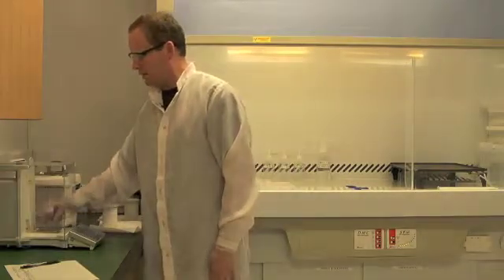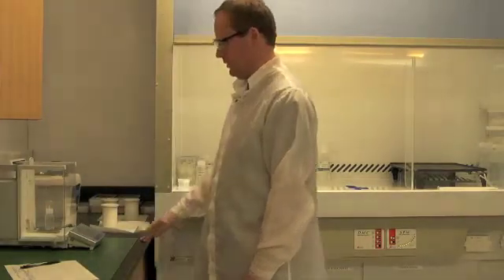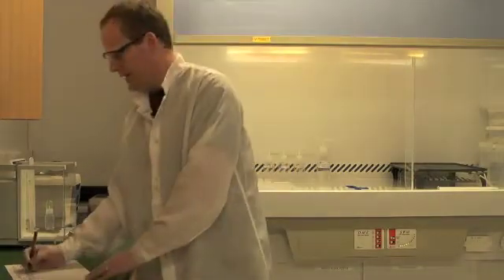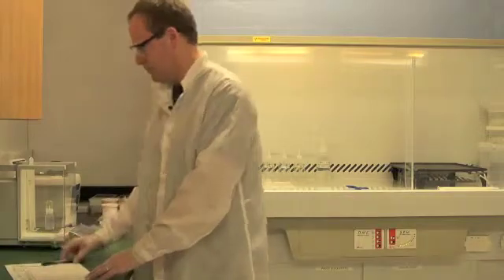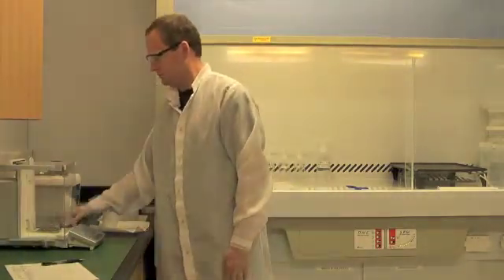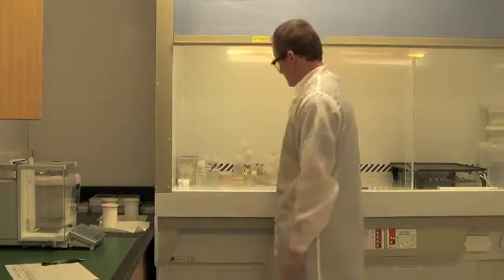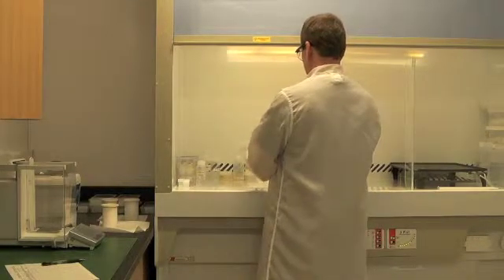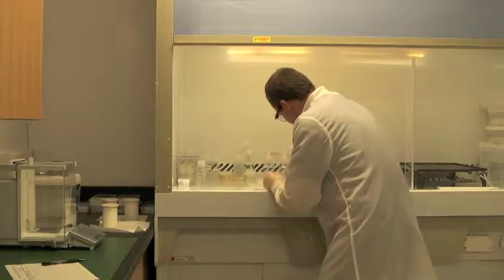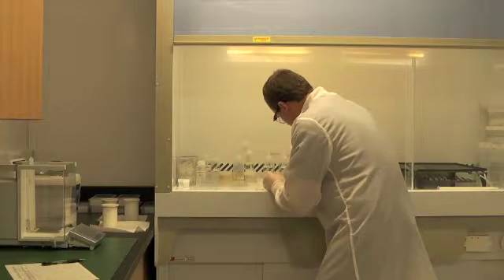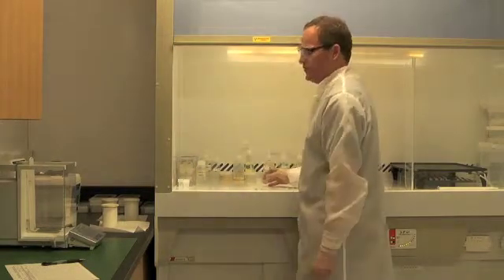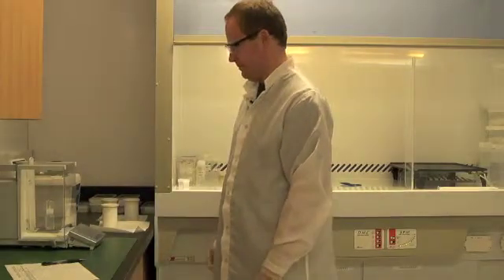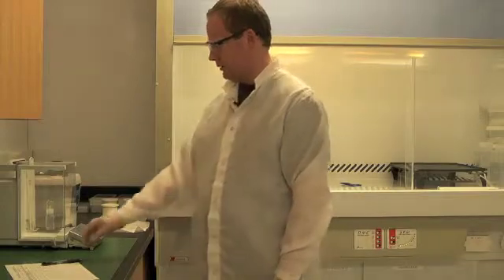I'm going to weigh the spike bottle before dispensing, record the weight. I'm going to dispense some spike into my capsule. I know that approximately three drops is the correct amount of spike, but I'm going to weigh that carefully to determine a final weight.